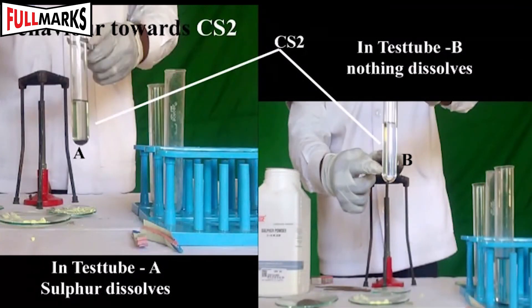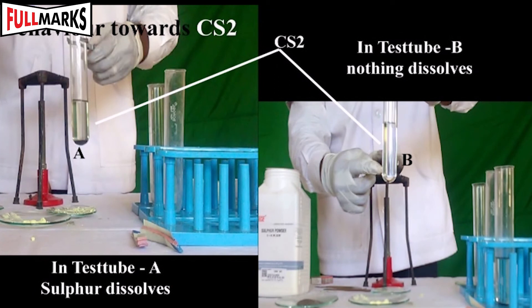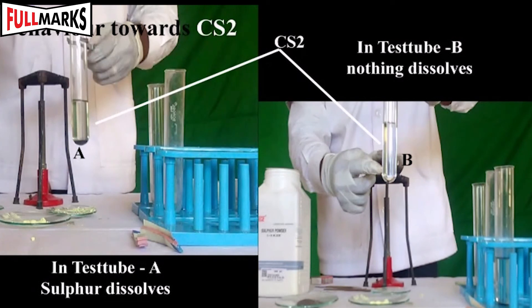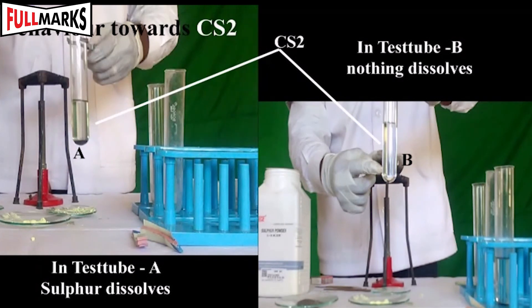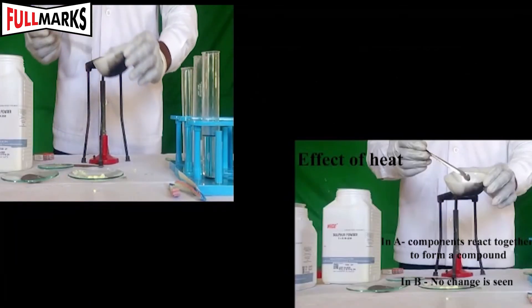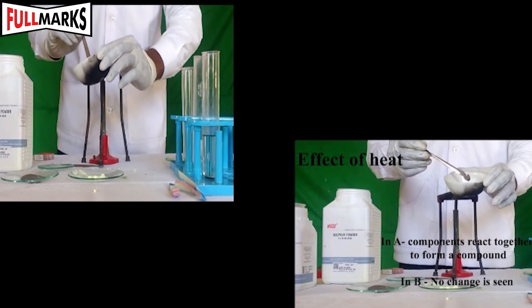Behavior towards carbon disulfide: Take components from watch glasses A and B in separate test tubes and add carbon disulfide. In test tube A, sulfur dissolves in carbon disulfide and iron settles down, whereas in the other test tube nothing dissolves.